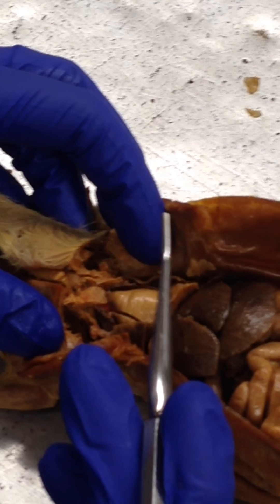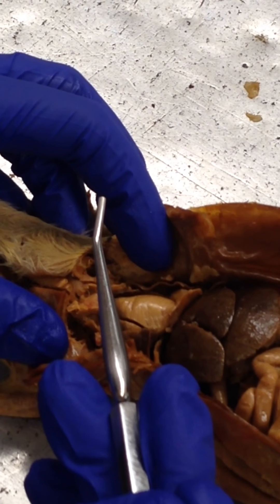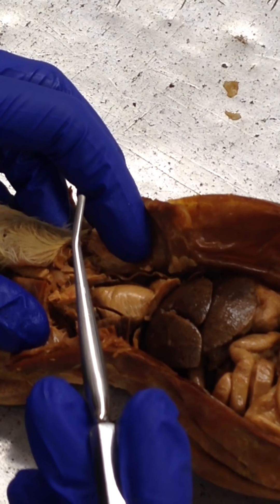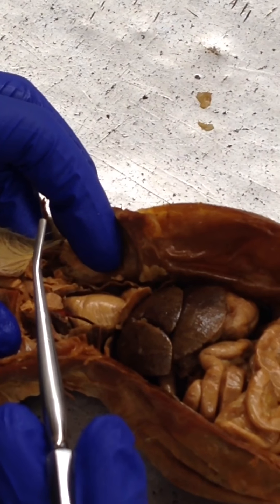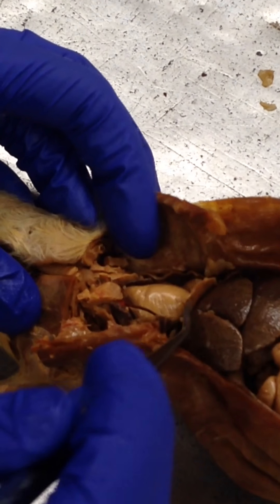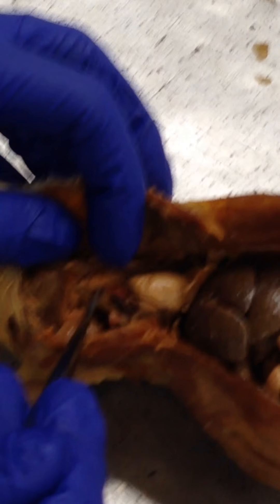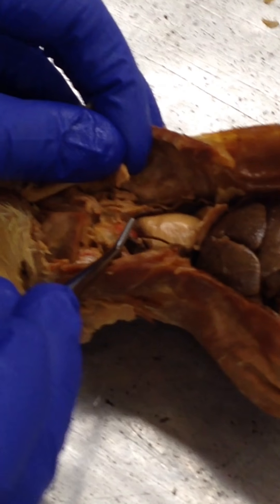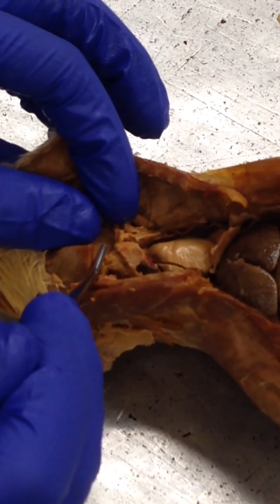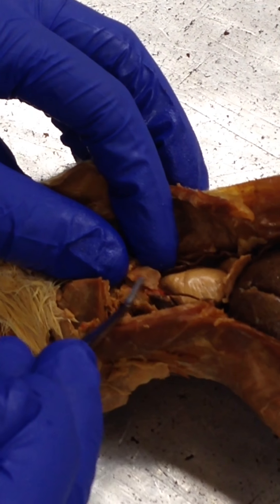The pulmonary artery you can't see on this specimen so we don't need to worry about it. The thymus gland is this part that got ripped off, but it sits on top of the pulmonary trunk. So this is the pulmonary trunk and then this is the thymus gland.